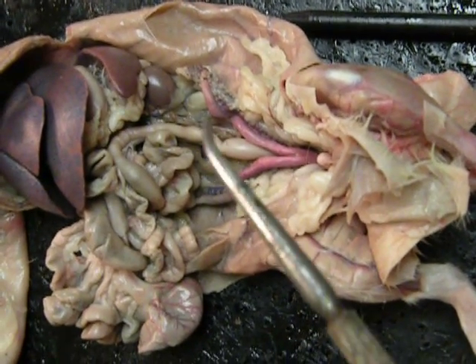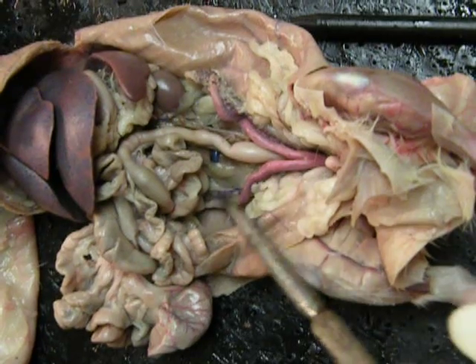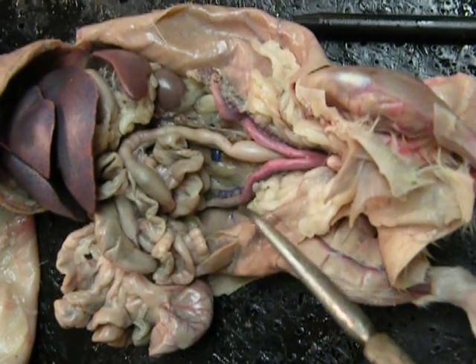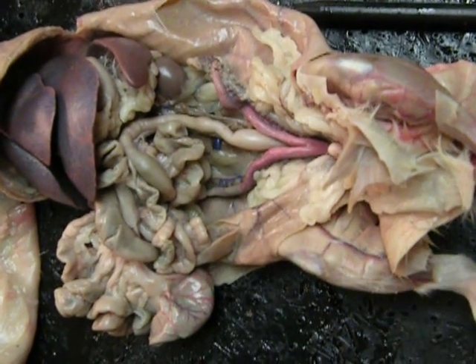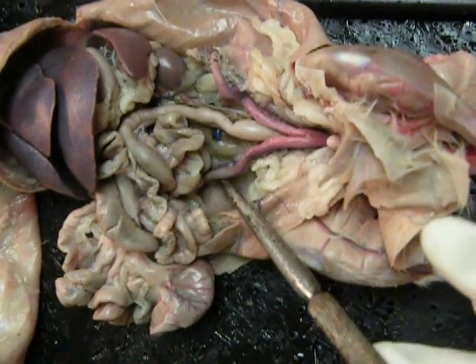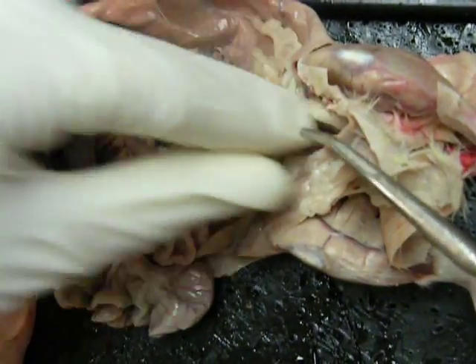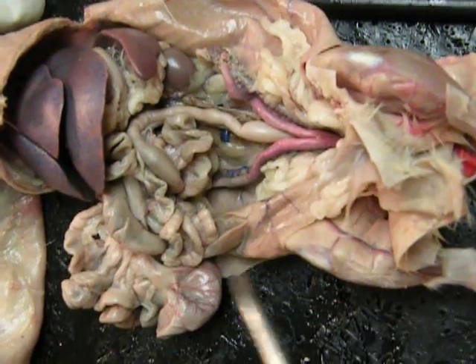So this is a female, and this is a uterus, and it is duplexed in the rat as opposed to simplex in the human. Duplexed because it allows them to have a lot more babies at once. There are two entrances to the vagina.